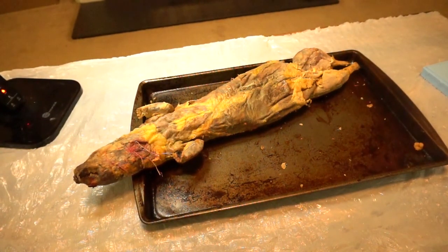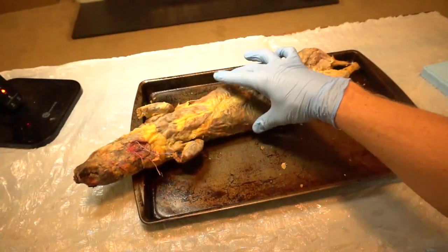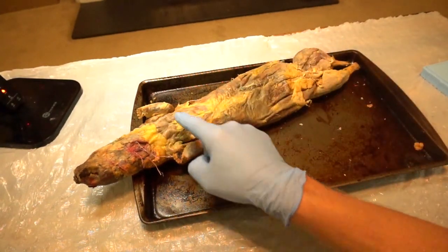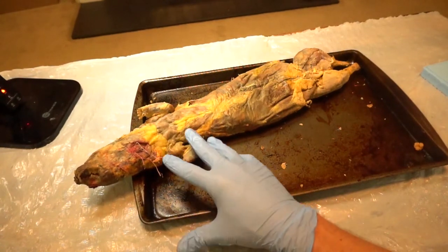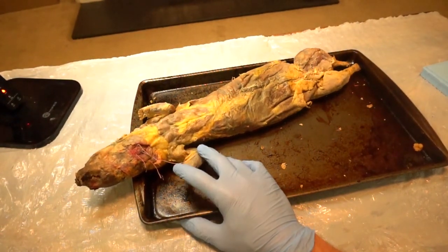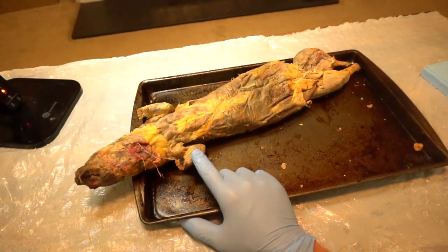On your list we're going over sections 4, 5, 6, 10, 11, and 12. That is all the thoracic area — the chest area — and your abdominal area. We're even going to do the forearms, which will be very difficult to see on a mink. Cats have longer arms, so their muscles are more defined, but we will still try to get into this arm and see what we can find.